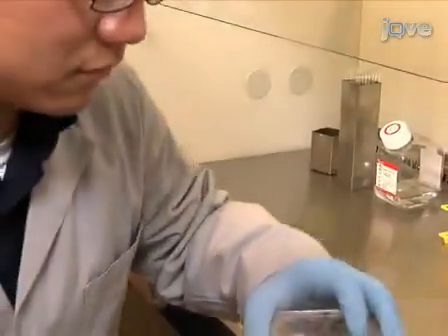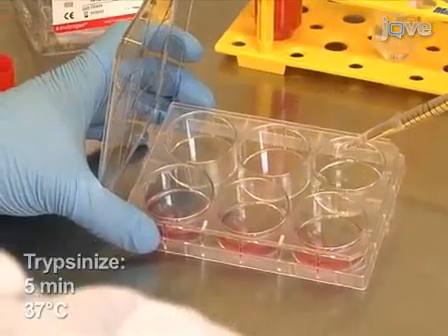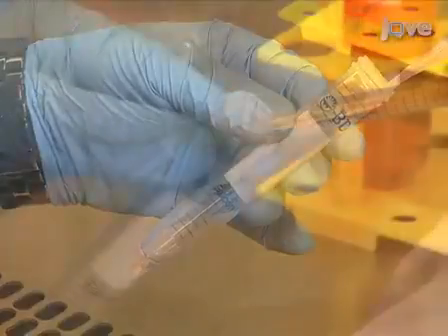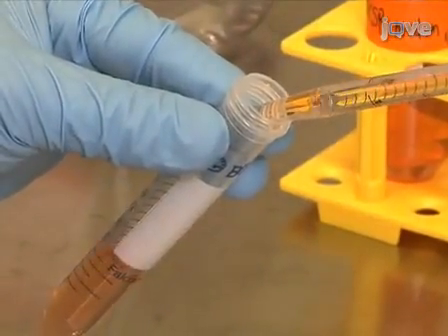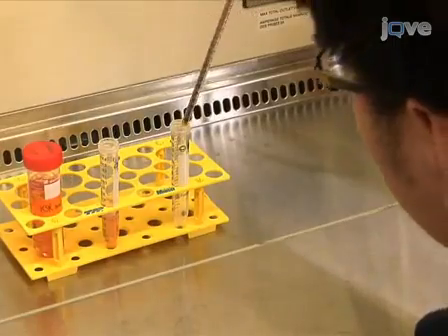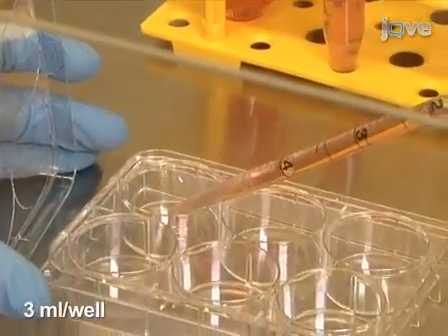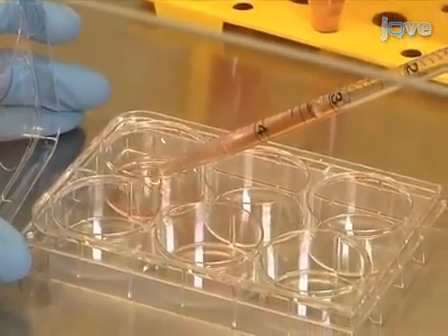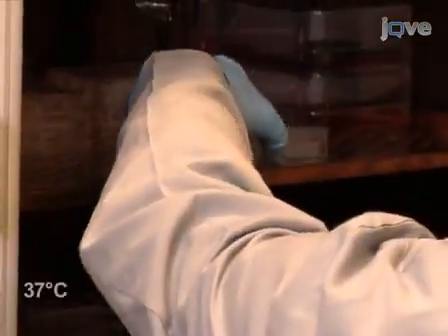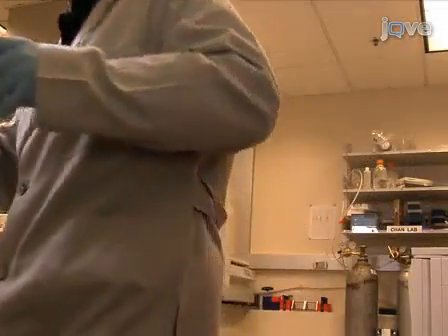To induce embryoid bodies and begin differentiation, trypsinize mouse ES cell colonies as before, and then resuspend the cells in knockout serum replacement, or KSR, medium. Count the cells on a hemocytometer. Dilute the suspension in KSR medium to 15,000 cells per milliliter. Plate 3 ml into each well of an ultra-low attachment 6-well plate. Culture the suspended cells at 37 degrees Celsius for 4 days. Change the medium completely every 2 days.